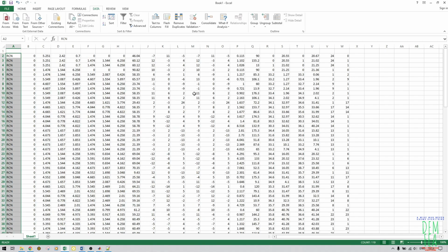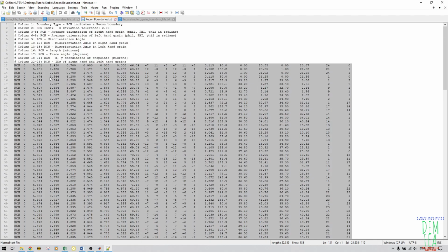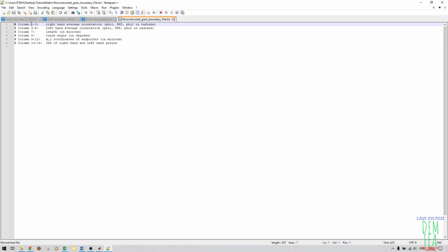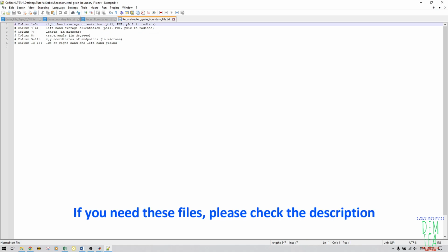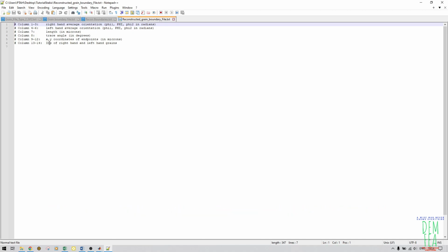So the next thing that we need to do, as you can see, we have more than the columns that are required, because here we have column 1 to 23, but the one that's recommended is 1 to 14. And as you can look here, we have right hand average and we have left hand average, and then we have the length, trace, angle, xy coordinates, and IDs of right and left hand grains.